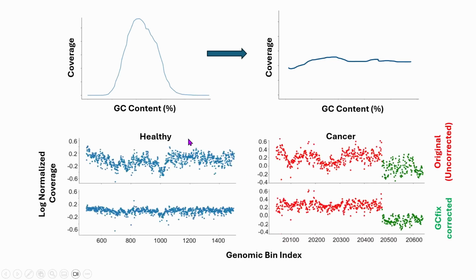For example, here on the top side, these are the original uncorrected coverage profiles. So what is a coverage profile? On the x-axis right here, we have genomic bins. These are genomic bin numbers, bin number 600, bin number 800, and so on. So these are bin regions. And on the y-axis, we have the normalized coverage. You can see that the normalized coverage for the different bins is very, very different. It is very heterogeneous. Now, in a healthy sample, the coverage profile is not supposed to be heterogeneous. It is supposed to be very uniform across the whole genome. When we do the GC correction, you can see that after correction the coverage profile is now very, very uniform. You can see that I have written here GC fix corrected.